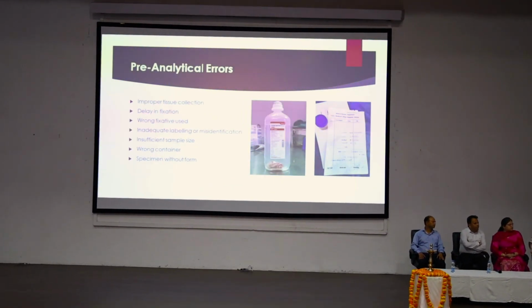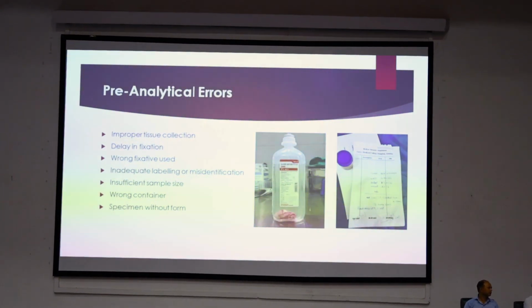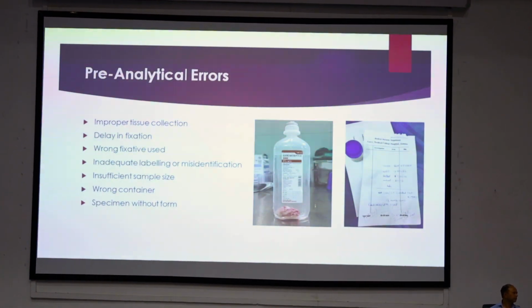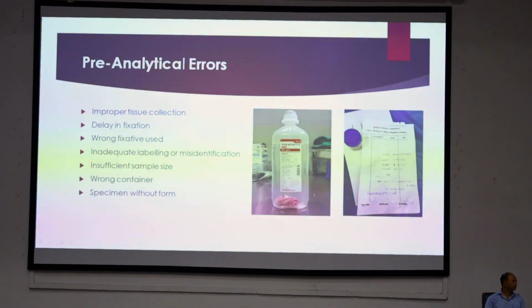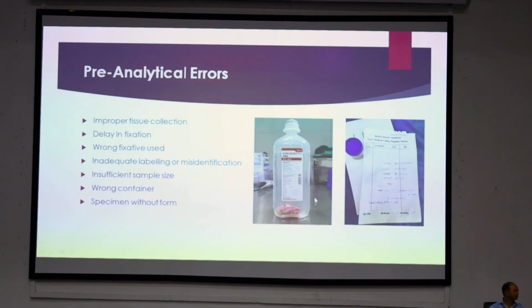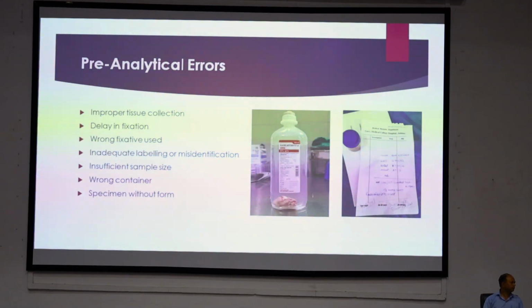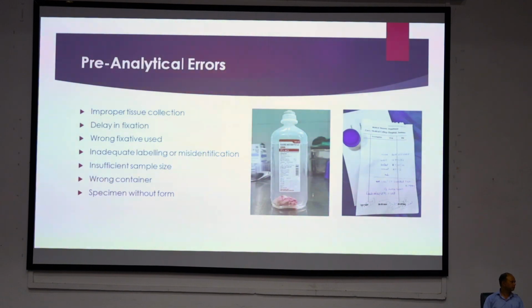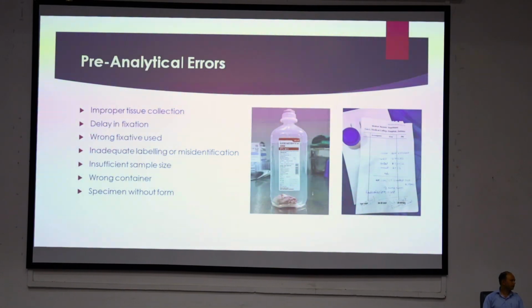Wrong fixative use. Sometimes they use a fixative that is not appropriate. They sometimes send us in alcohol. As you can see here in the slide, there is a bottle, a DNS bottle. Though DNS is a good fluid, it's not a fixative. Here the autolysis and putrefaction start immediately because DNS is also a good place for microbes to grow. So putrefaction is definitely going to attack.